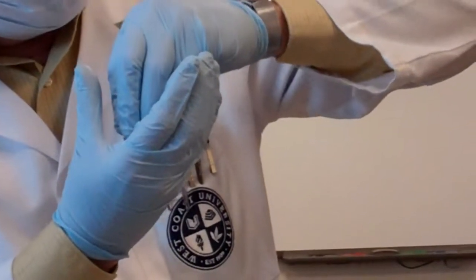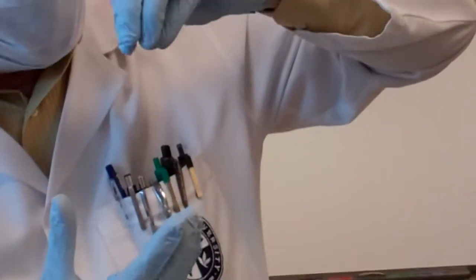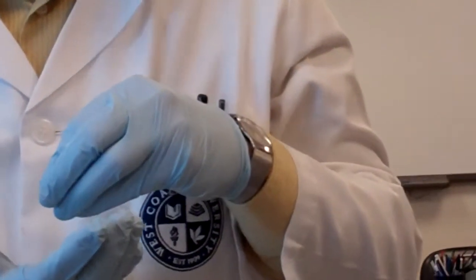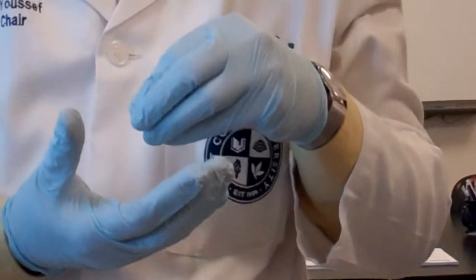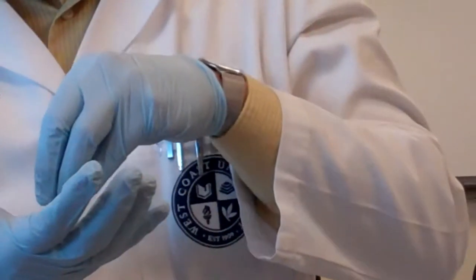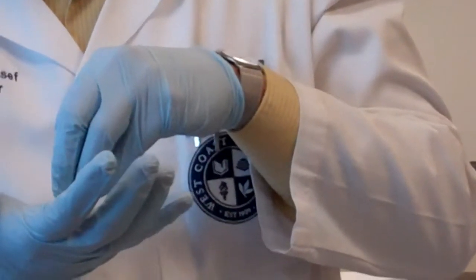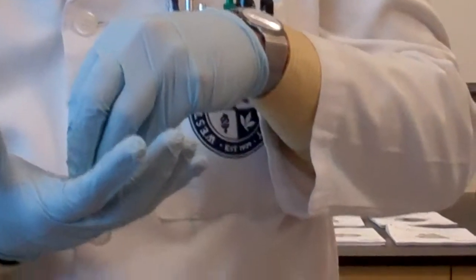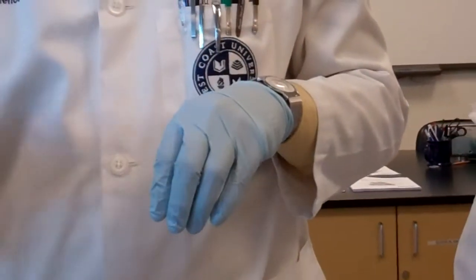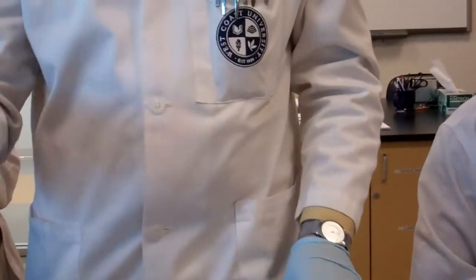Now, what is the tip of the pyramid called? It is called the renal papilla, because you know what papilla means. It looks like a little nipple. So this is the renal papilla. The renal papilla opens into the minor calyx. A couple of minor calyces together make up a major calyx.